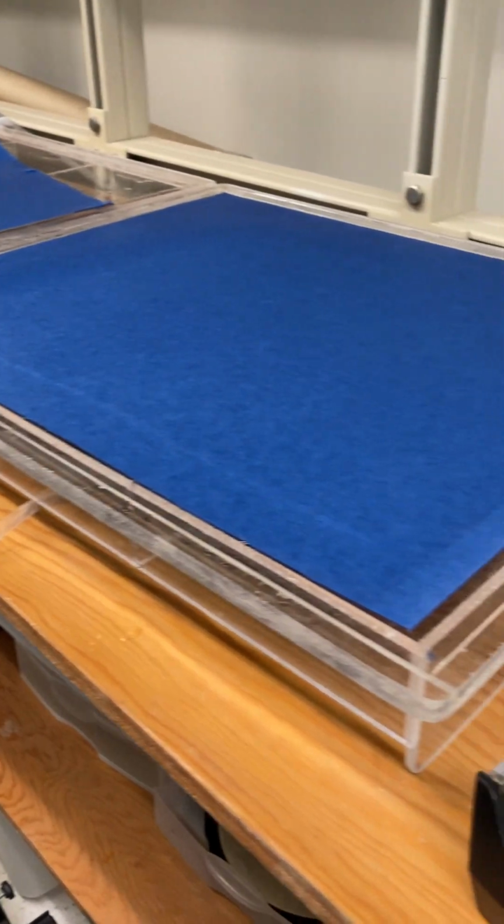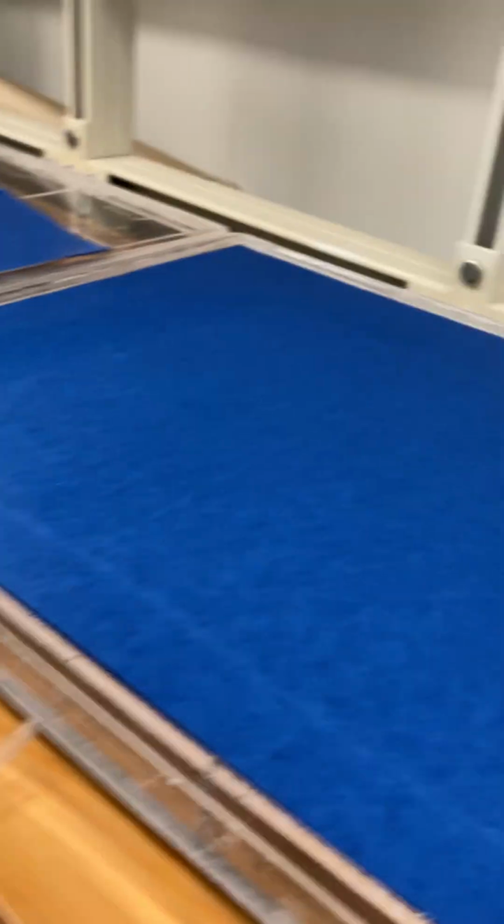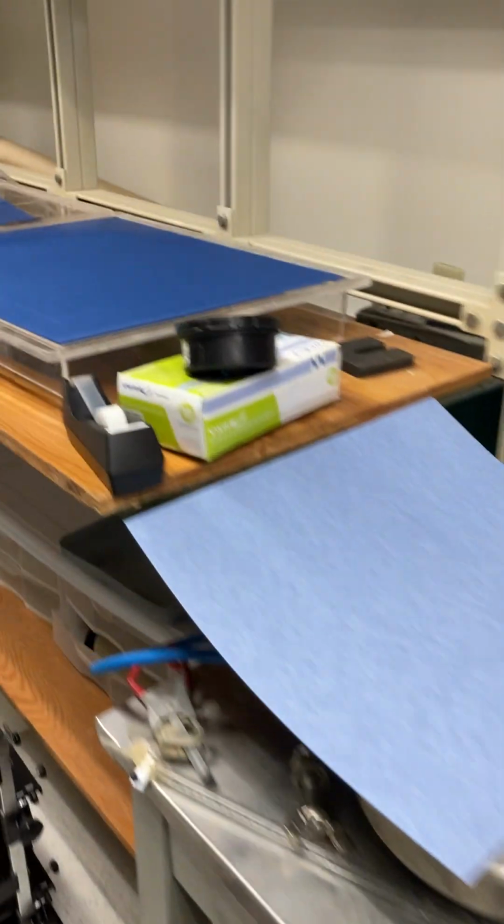Okay, so you can see pretty much the free water is virtually gone off the top, and there's still no air in here. So what should happen when you spritz this, do you have like a squirt bottle, or we can just use my fingers here? When you splash water on this, it's not just going to drain through, it should get actually yanked downwards. So if you watch this, see how it goes away so quickly?